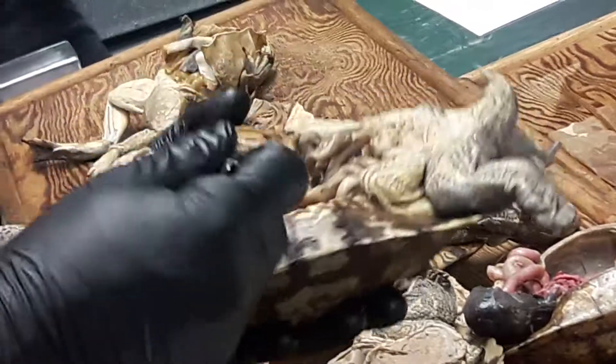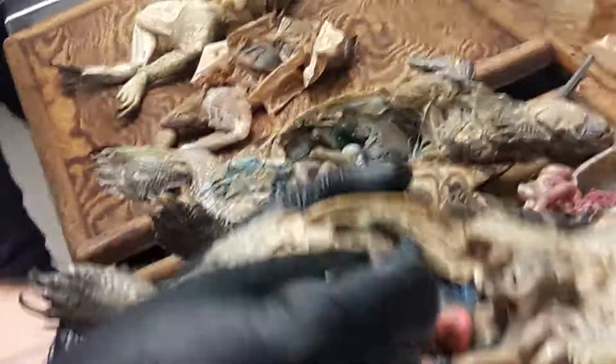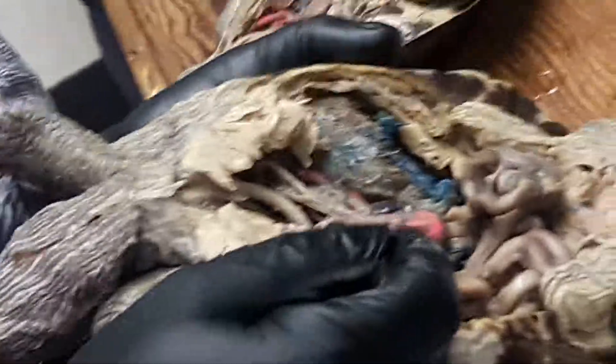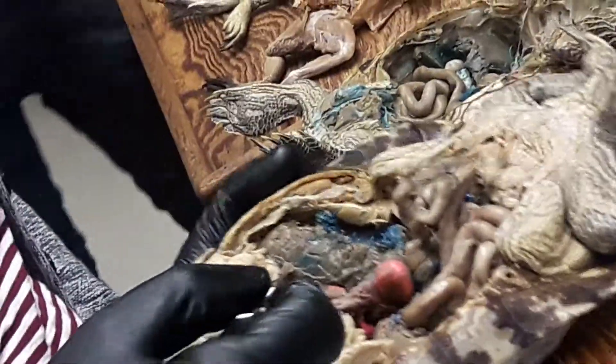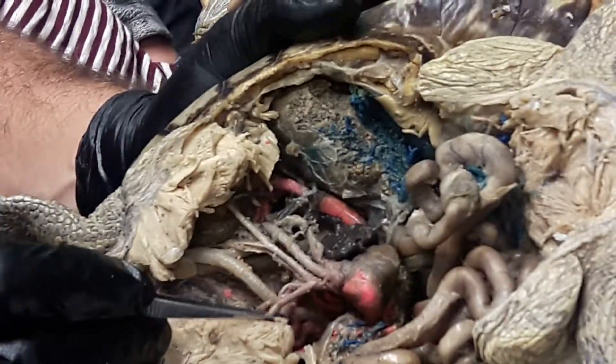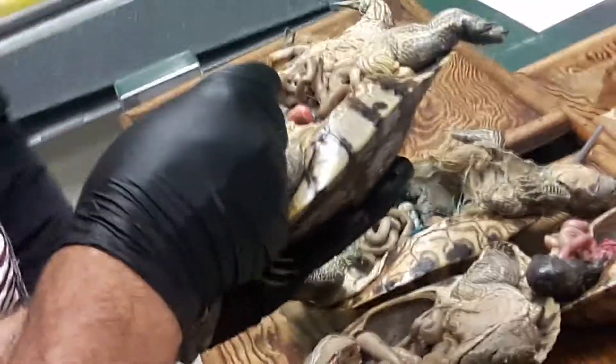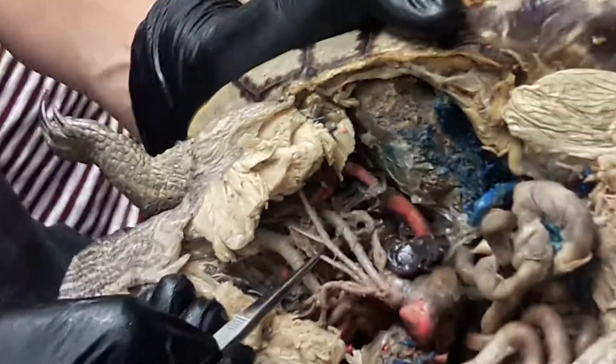The main thing I wanted to point out is what's going on with the right systemic. Here's the right systemic trunk coming out, and then there are all these other arteries coming off of it — it looks very confusing. What's happening is we have the left and right subclavian arteries. This is the left subclavian here, and this would be the right subclavian here. You can see those running over towards the limb. And then back behind that, there's another artery also coming off — this is the common carotid. So this is the left common carotid artery, and over here would be the right common carotid artery.